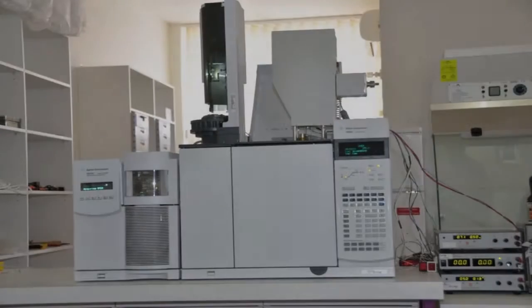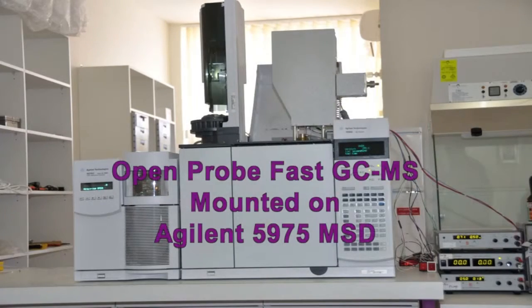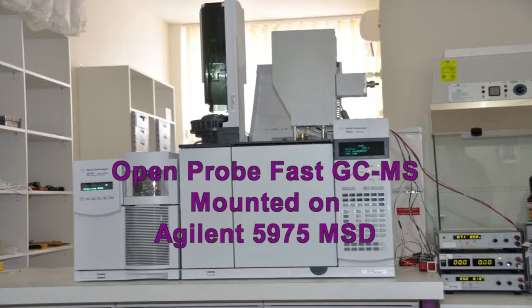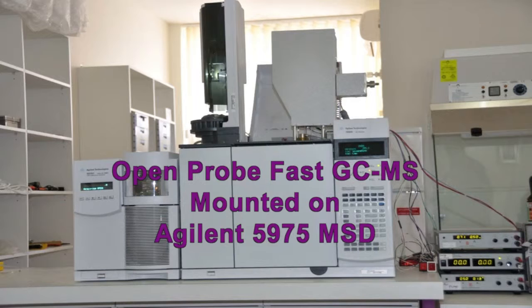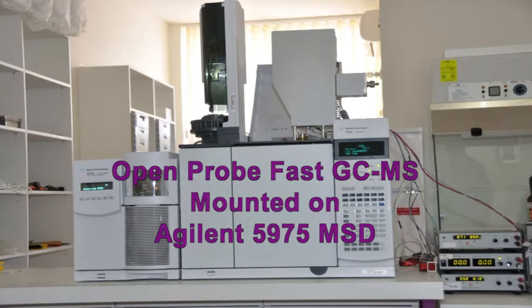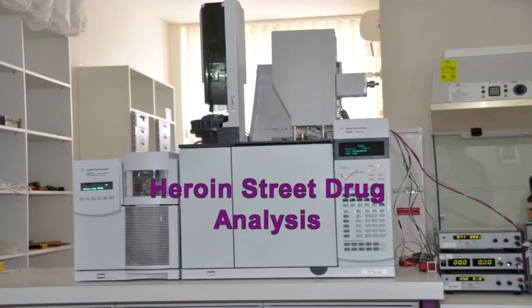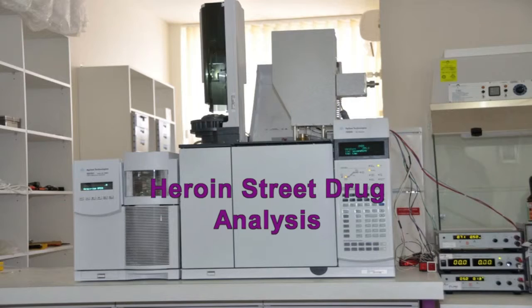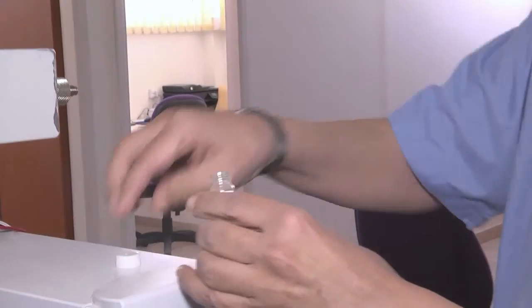We are now going to demonstrate the operation of the open probe fast GCMS with Agilent standard 5975 MSD, with the analysis of heroin in its street drug powder. I'm now taking a vial with street drug heroin.